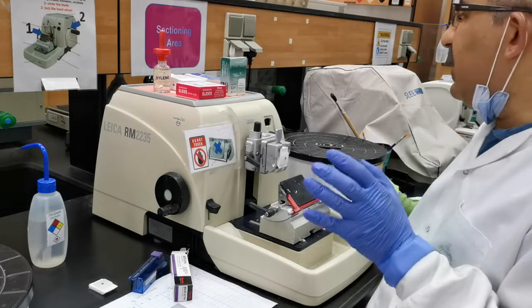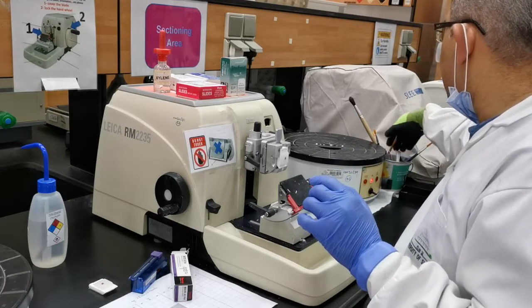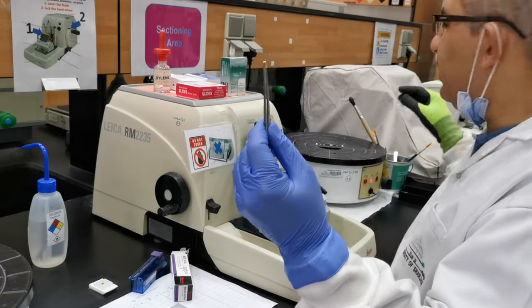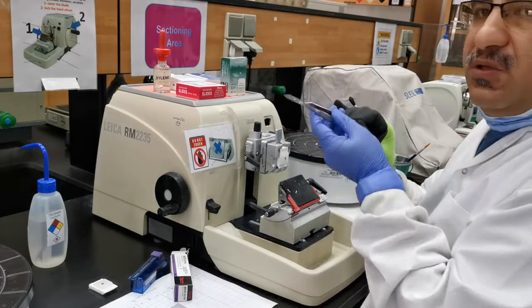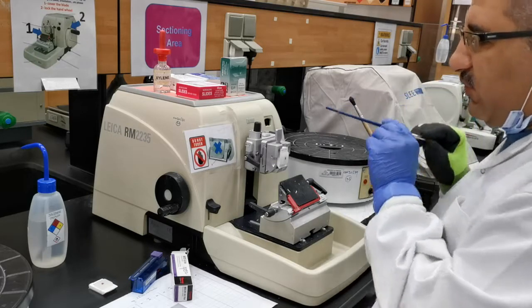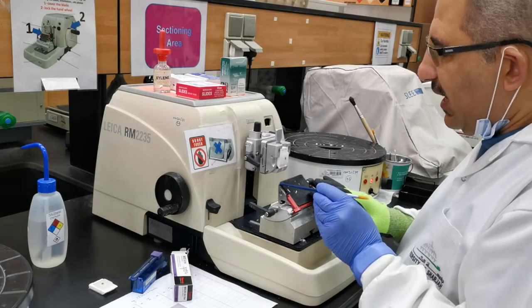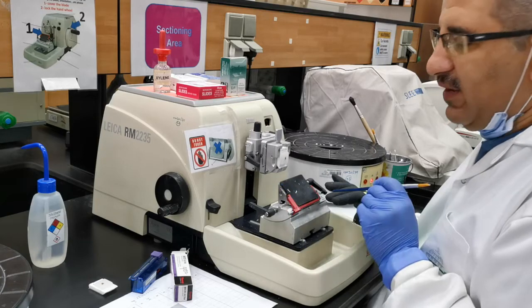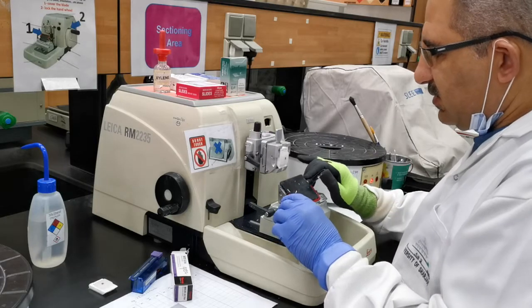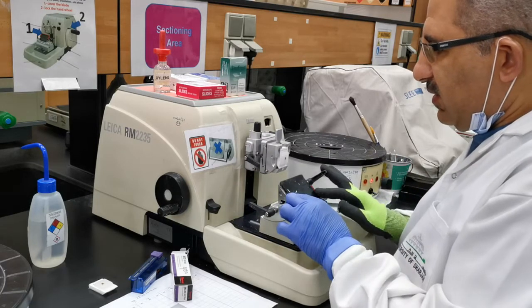Once you place the knife, please make sure you don't use metal things touching the edge of the knife — this will make marks. Some people might use metal things; please don't use them near the knife edge. If you want to adjust the side, use something wooden. Touching the edge of the knife will cause marks to happen.